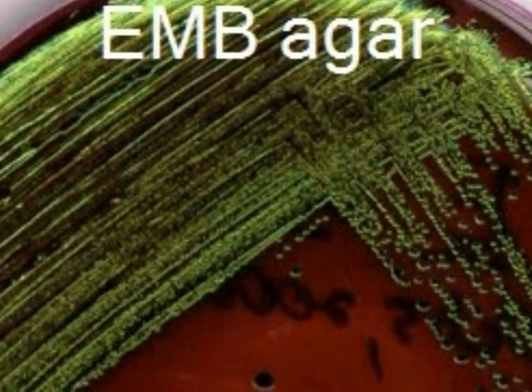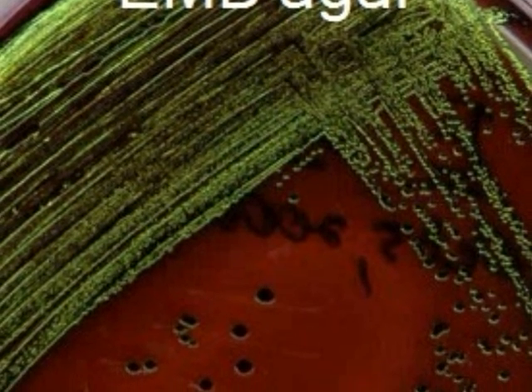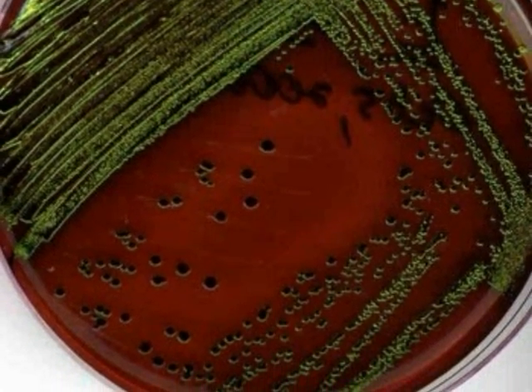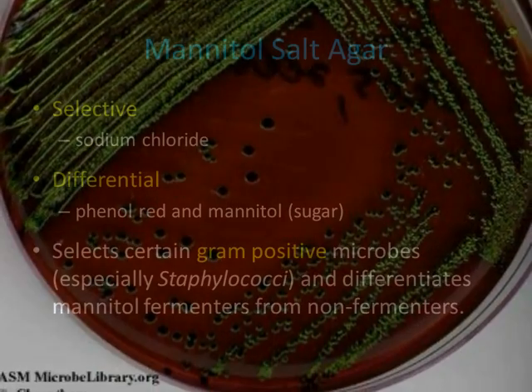In this example of EMB, you see a striking green metallic sheen on the medium. This unique coloring comes from microbes that ferment lactose vigorously, such as E. coli. Your interpretation should be, the microbe tolerates the dyes present, ferments lactose, and is most likely a coliform.